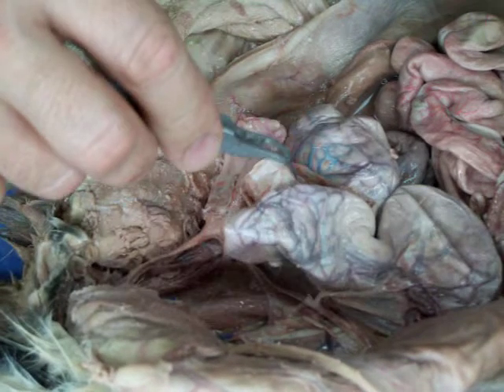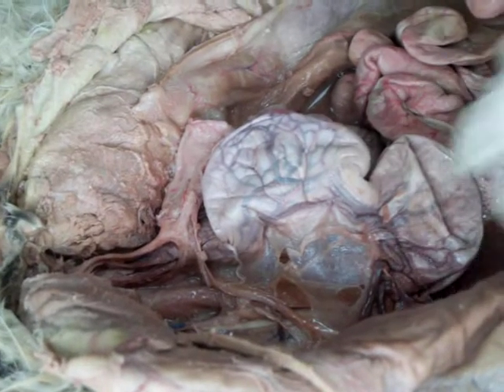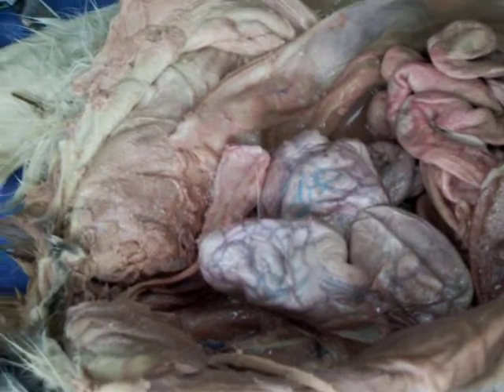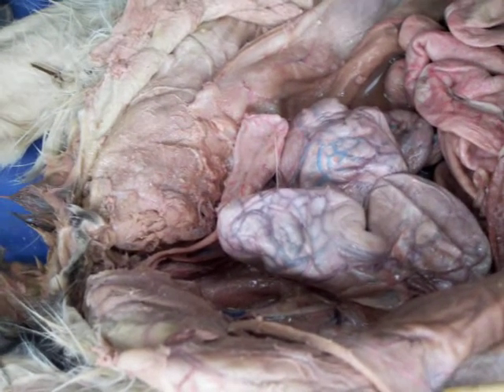Okay, that's about everything. That seemed way less complex than the reproductive system. Well, you don't have the tubes. And with the male, tomorrow what I'll do is I'll cut a male, and we'll dig back in the pelvic outlet to see the bones, see if we can see the glands, identify all the glands.